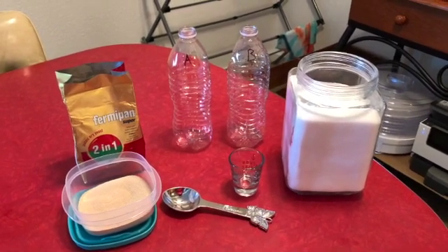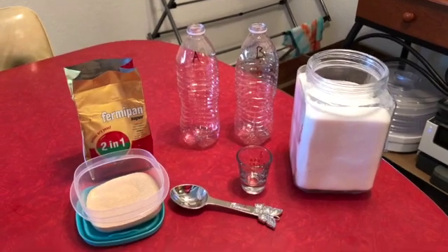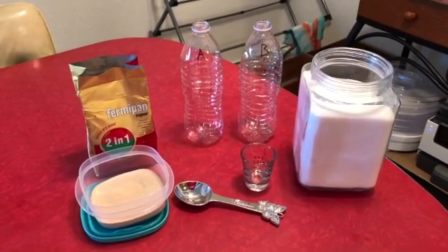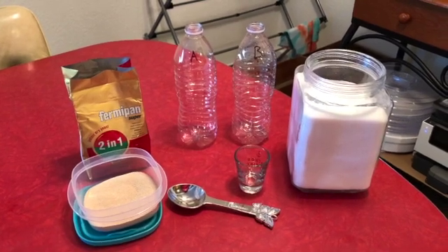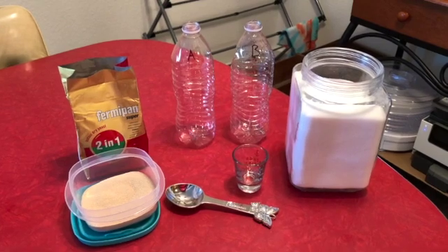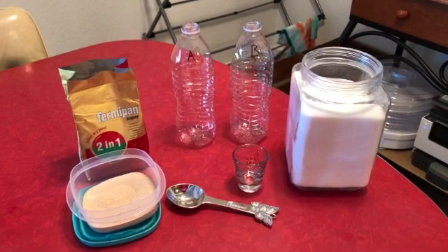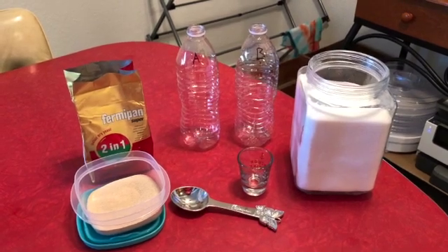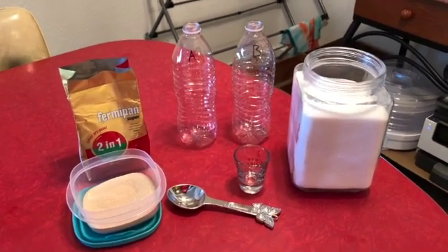So now that our bottles are labeled, we are going to put a tablespoon of yeast into bottle A, a tablespoon of white cane sugar into bottle A, and 1 cup of warm water from the range 105 degrees Fahrenheit to 115 degrees Fahrenheit. In bottle B, which is our negative control, meaning that no fermentation will take place, we are going to put a tablespoon of white cane sugar and a cup of water from the same temperature range.